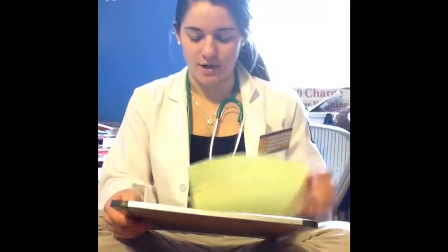Capillaries and lymphatic vessels take up the end product of the digestion and circulate it to the rest of the body and the liver. Further digestion of fats occurs in the liver. Waste product then enters the large intestine and is secreted through the anus. The liver creates bile, which is stored in the gallbladder and used in the small intestine to break down fats. The liver also stores carbohydrates as glycogen and metabolizes amino acids and lipids.